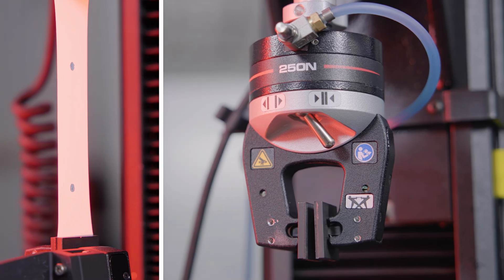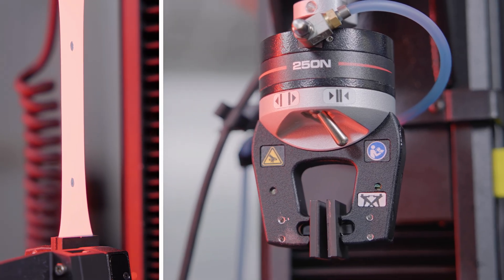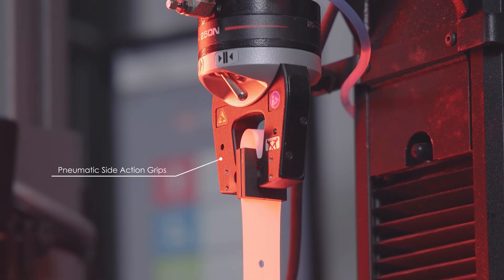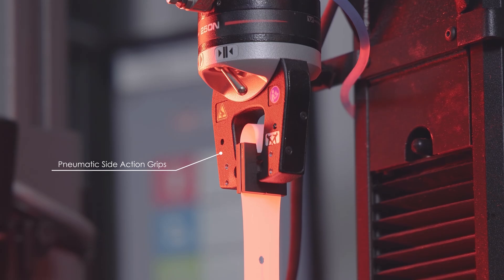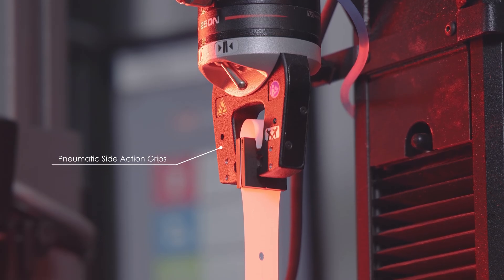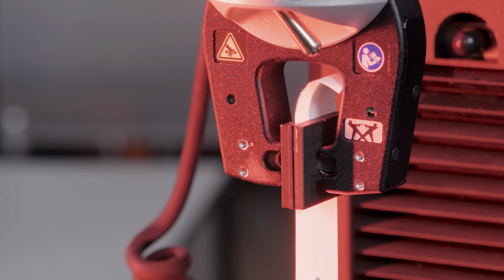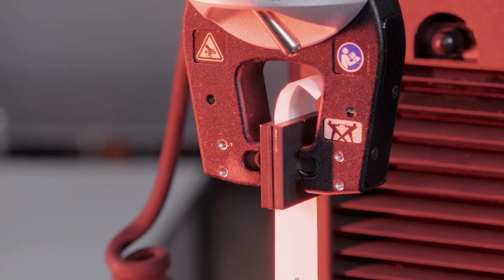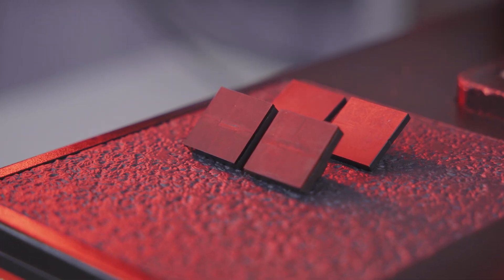Grips must be able to accommodate the thinning of the specimen as the test progresses. Pneumatic side-action grips are the preferred gripping solution because they provide a consistent clamping force. Jaw-face selection depends on the thickness and strength of the material; rubber or smooth faces are the most commonly used.